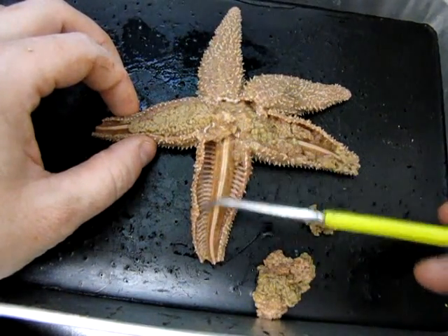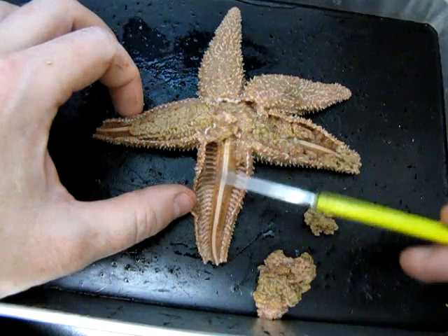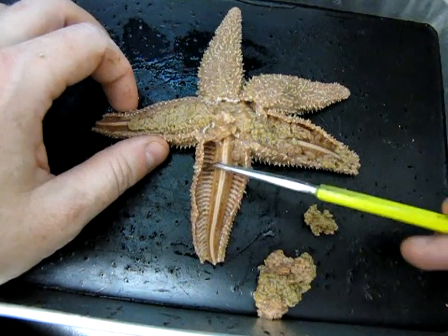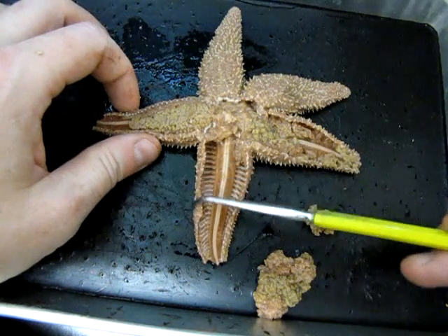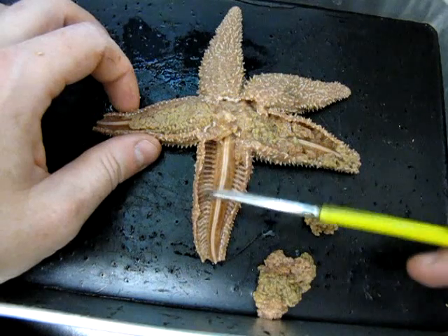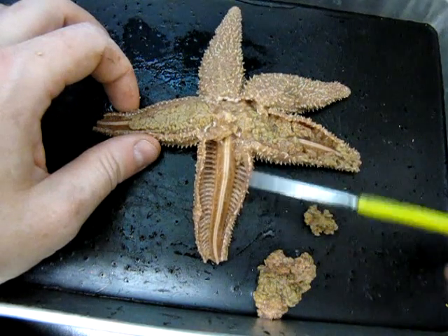These structures that look almost like little ribs running along here are called dermal ossicles — essentially dermal bones or skin bones. These form the skeleton of the animal, and they are connected to those spines we saw on the exterior. So the spines and the dermal ossicles are all part of the skeletal system of this animal.